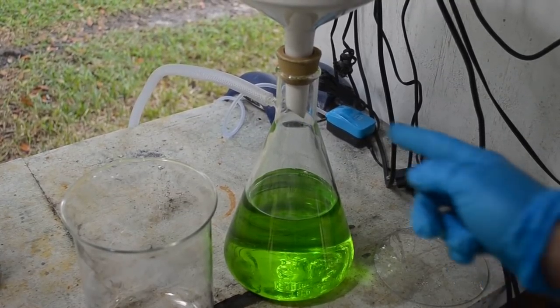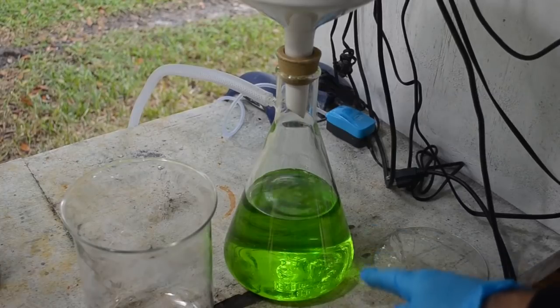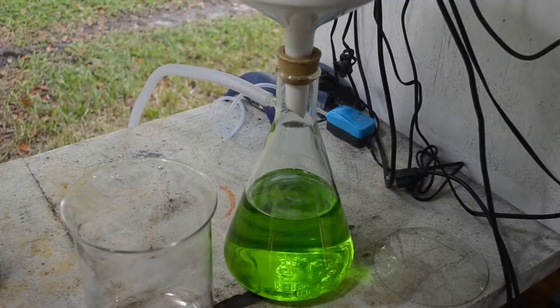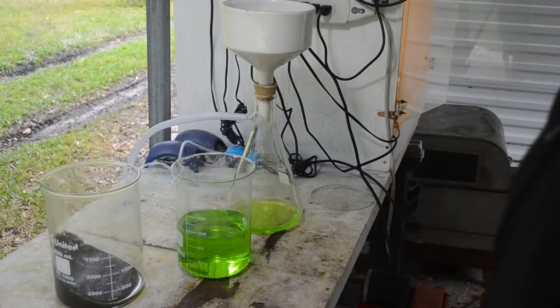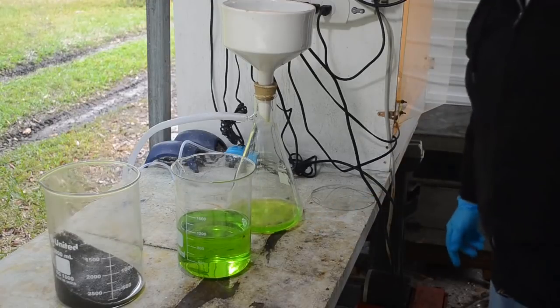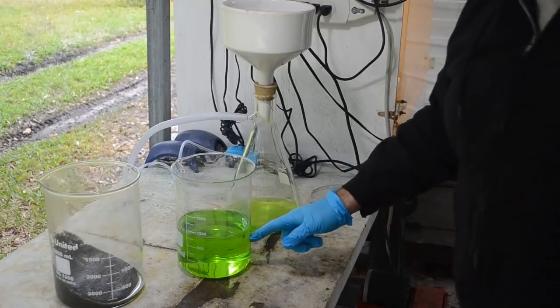So yeah, so I'll pour this in there and run it back through, and we should get a nice clear liquid. I mean, it's only slightly cloudy. The first liquid to come through was pretty cloudy, but now it's been diluted with a lot more liquid that's not so cloudy. But I want to get all the cloudiness out, so I'll run it through again. Okay, refiltering this lime green Kool-Aid through the now dirty filter. Yeah, it's looking cleaner. That's good. I'll get this all through.